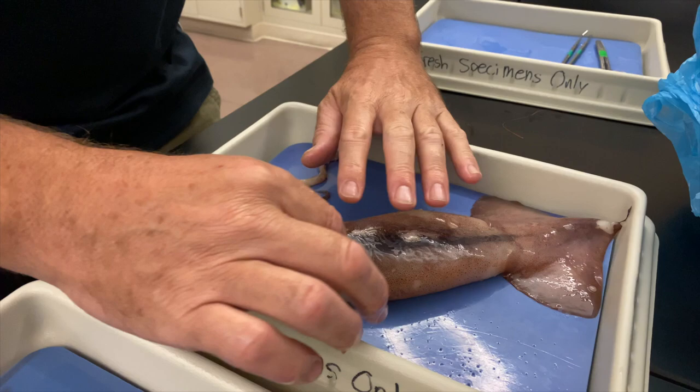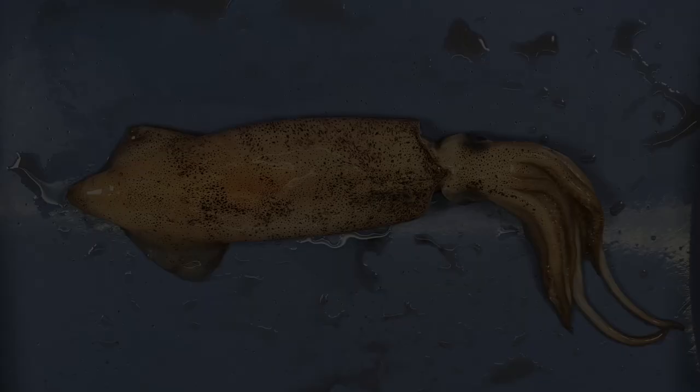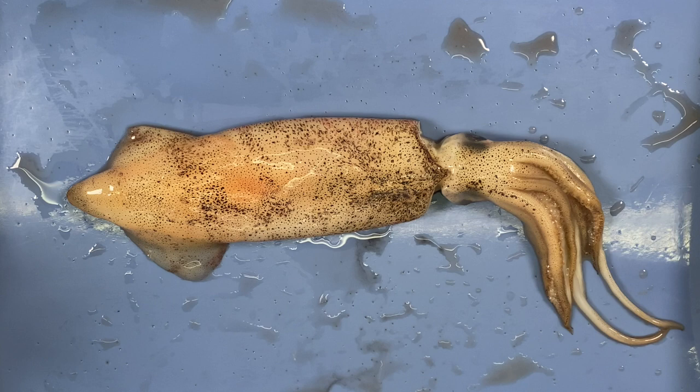So now we're going to explore our ocean delights and do some mollusk dissections. We'll start with these guys. We're going to look at organisms in the phylum Mollusca, which includes things like clams, oysters, snails, slugs, squids, octopuses, and the nautilus.